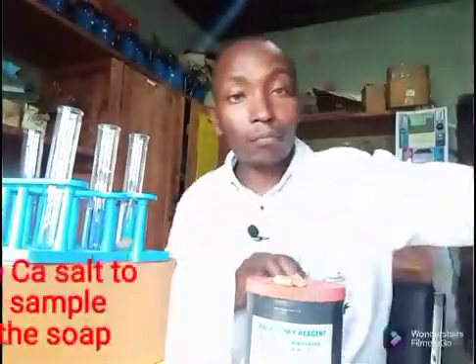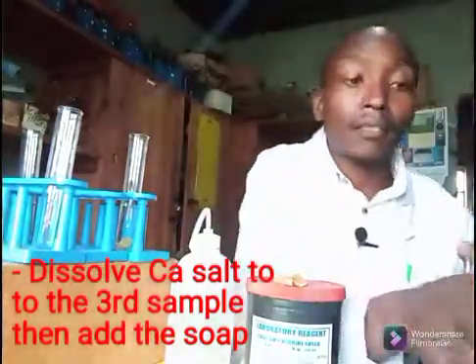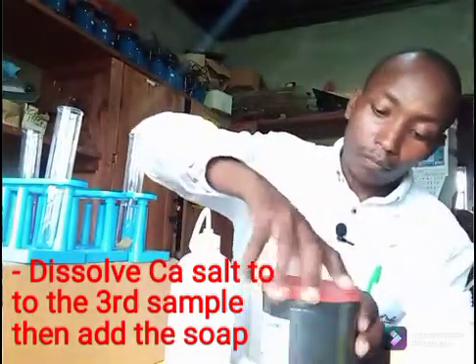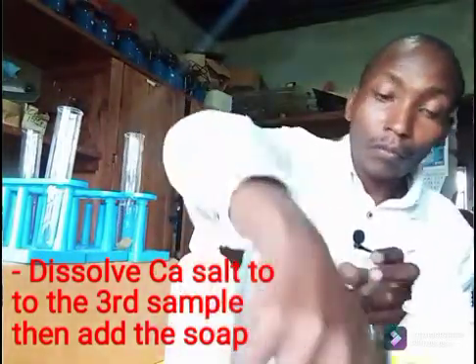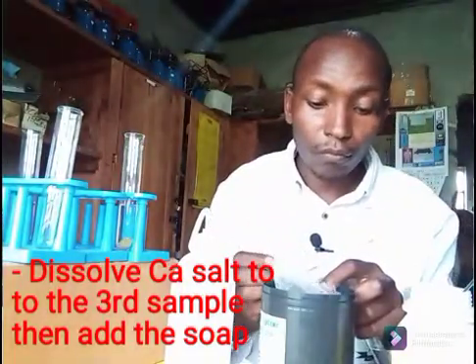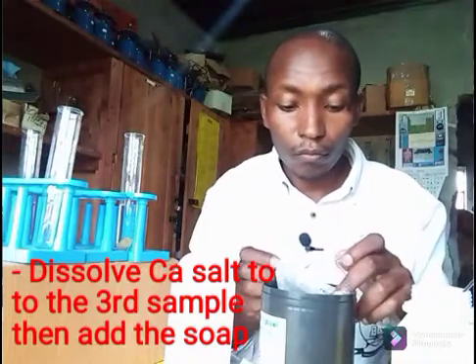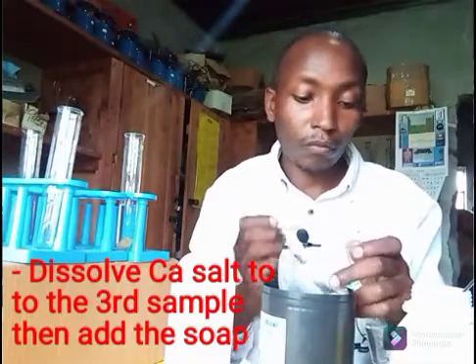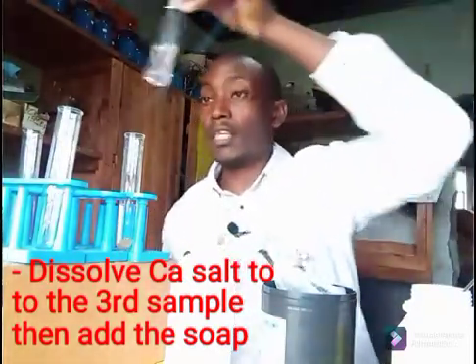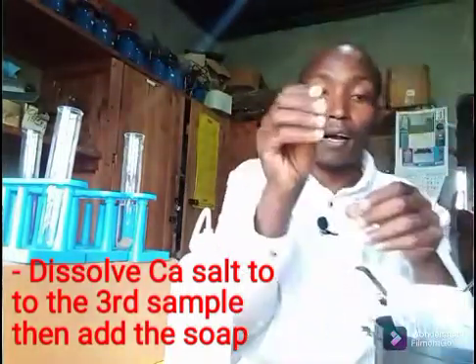In the next one, I will place a sample of calcium chloride. So this boiling tube contains calcium chloride dissolved in the distilled water. Then I'll add the soap.